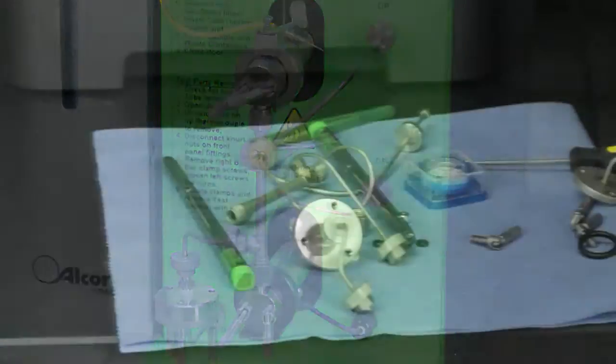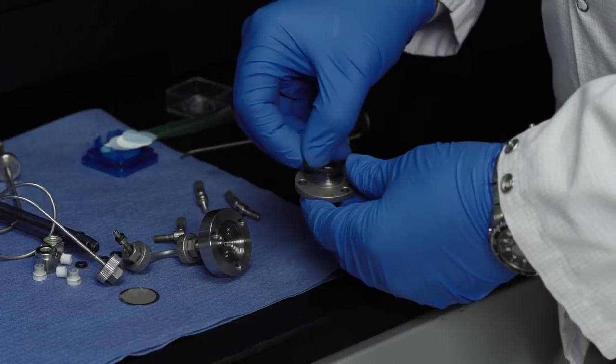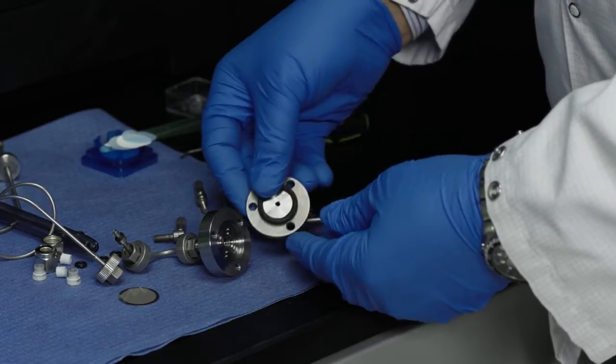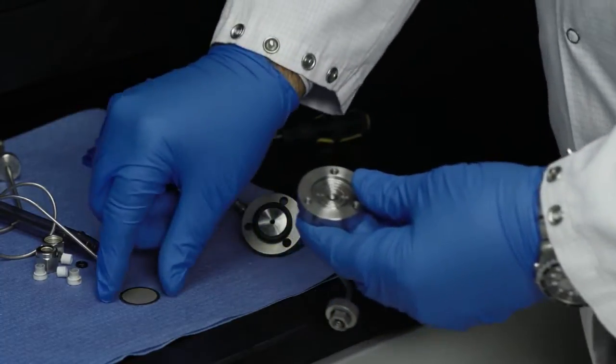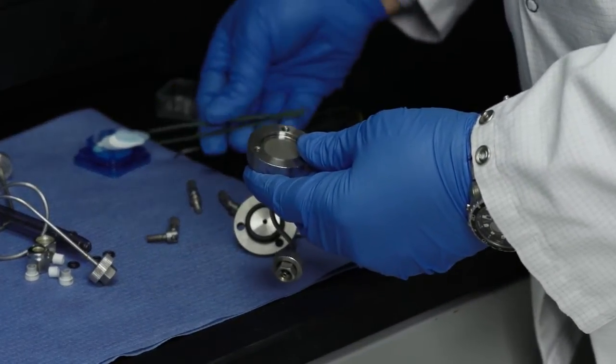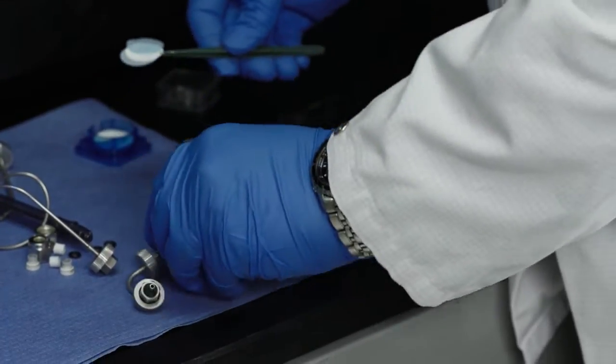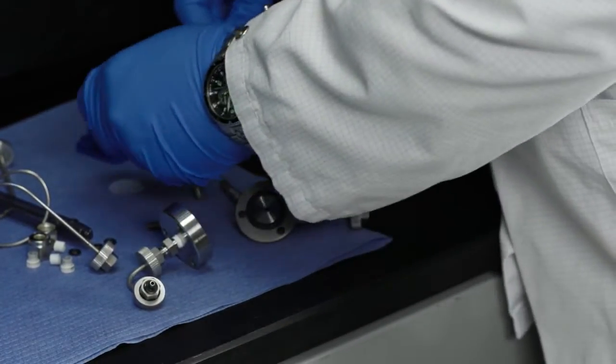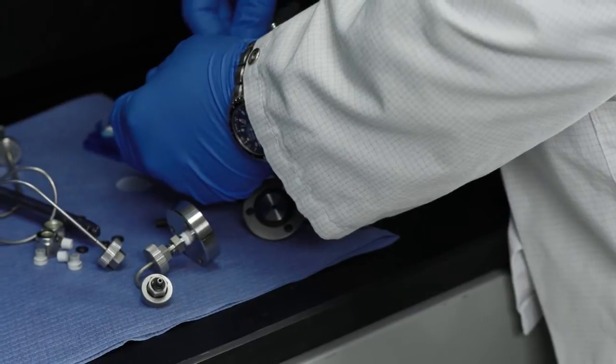Assemble the pre-filter. To do this, place the O-ring on the bottom cover, then place a white filter over the screen and the housing after quickly checking both sides of the filter to verify no blue separator is attached, and close the assembly.